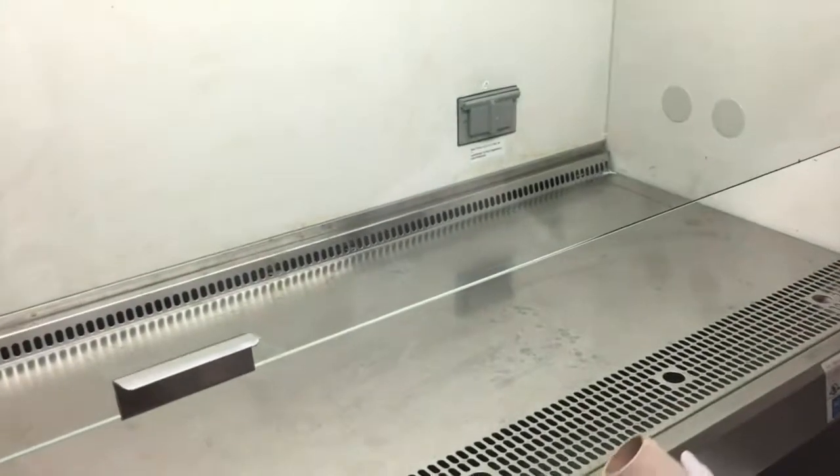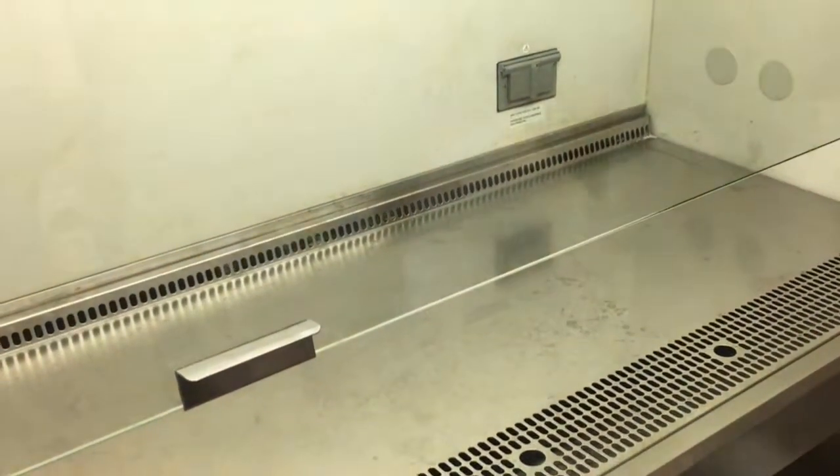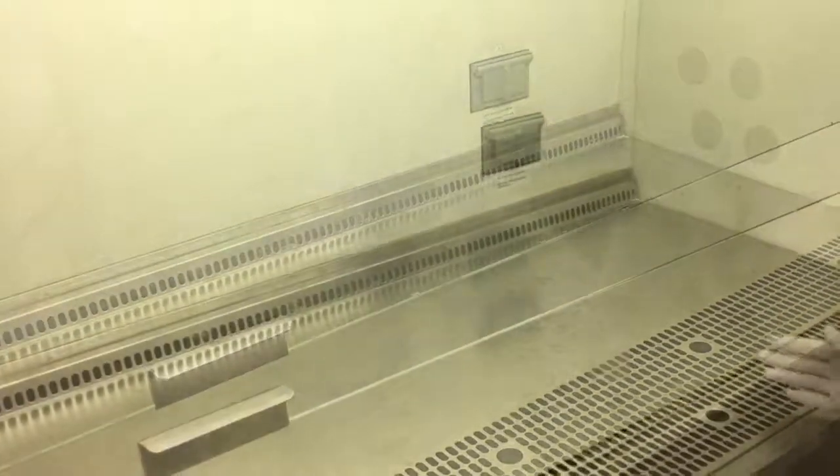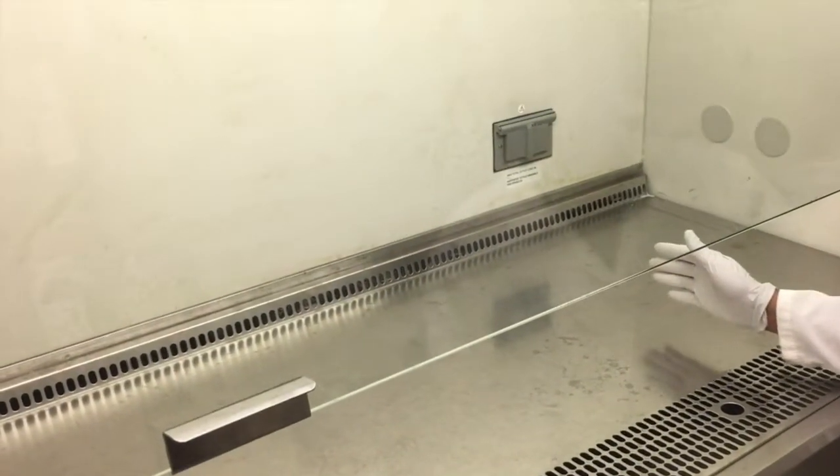When working in the cabinet, be sure not to block the grill with your arms. When entering or exiting, move your arms straight in or out in a smooth, even manner to limit disruption to the airflow.